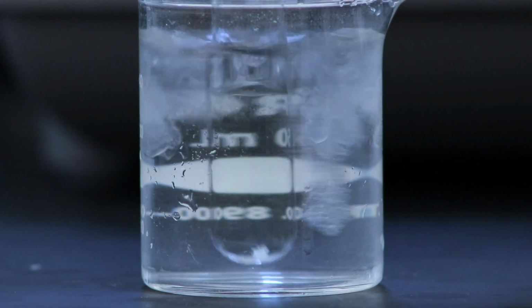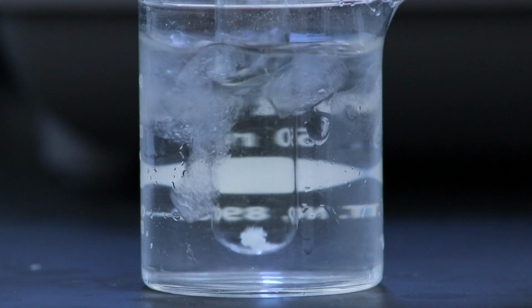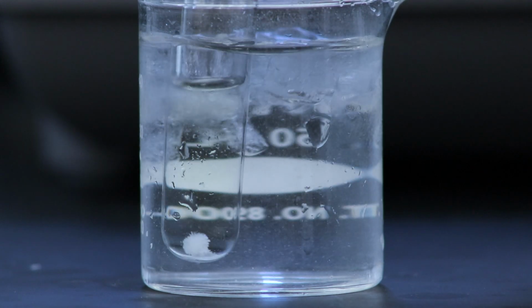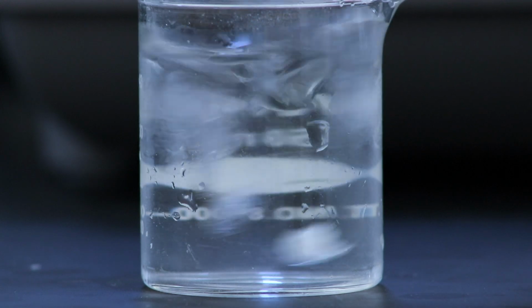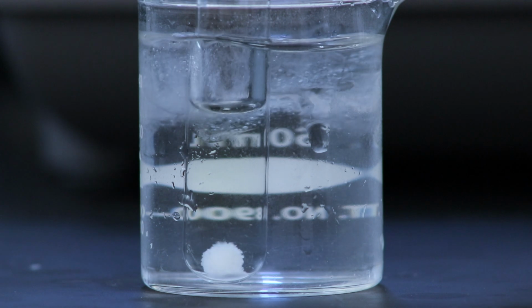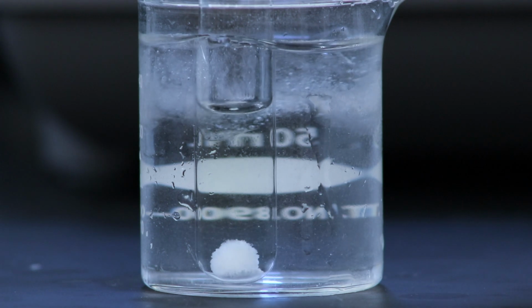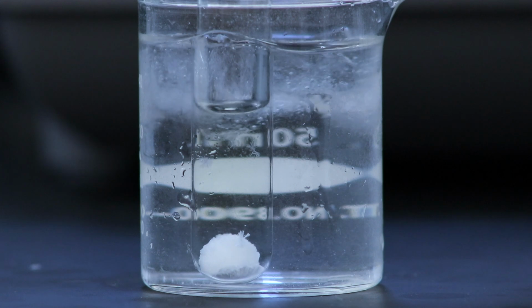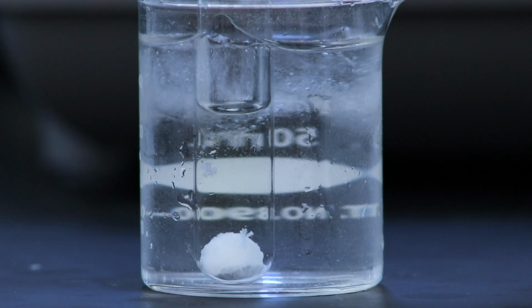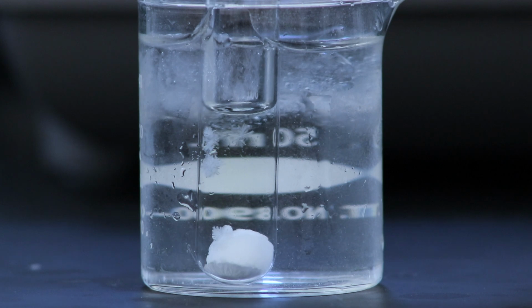Here you can see some of the product coming out of solution at the bottom of the test tube, and if this happens slowly enough in an ice bath, it could produce pure and large crystals that would be perfect for characterizing. So it doesn't really matter what temperature you do this at, as long as the product recrystallizes slowly. Usually we do it at room temperature because that allows the product to come out of solution and recrystallize at a slow enough rate to form pure crystals, but it could also be done in an ice bath if it's slow enough.